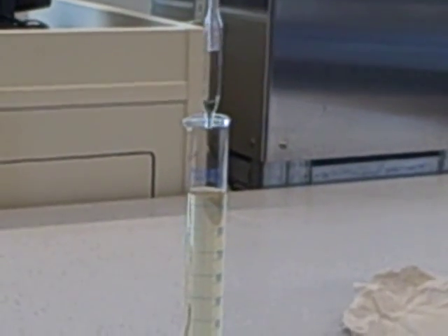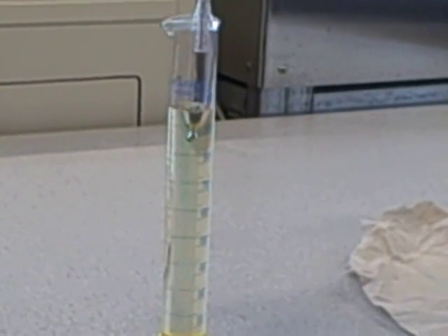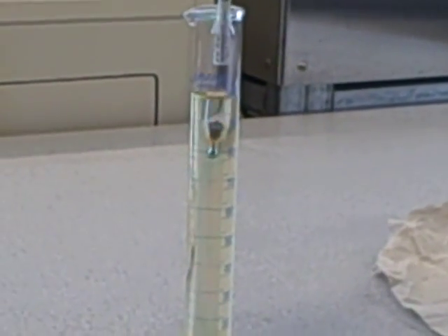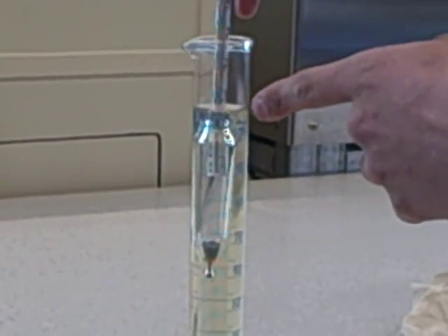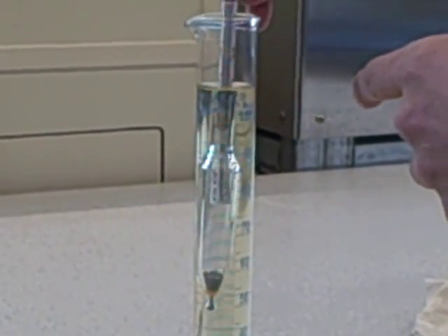You place the hydrometer in the liquid and push the meter down to about there.